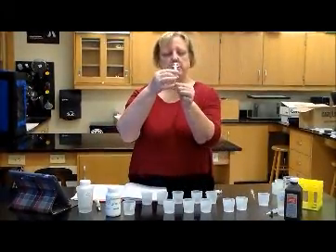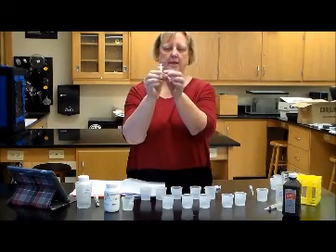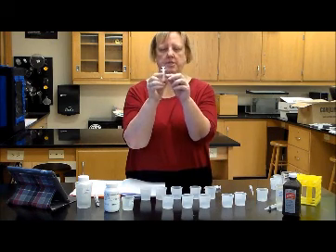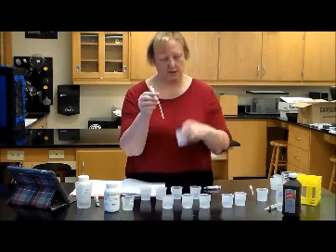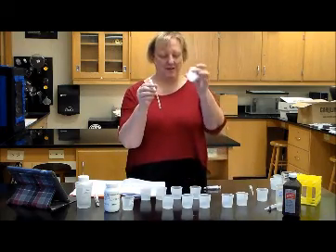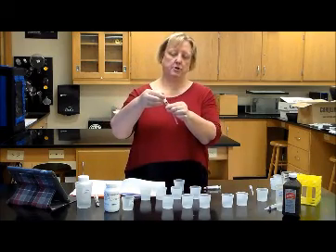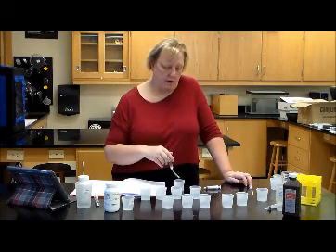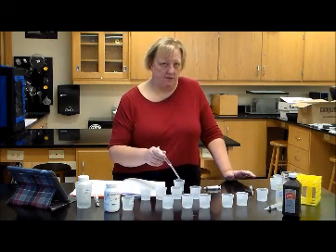and you're going to fill up this special syringe with the potassium permanganate. Make sure that you read very carefully how much you put into this tube. Then, again, do this with your titration cup, not in your individual cups, because you'll have to start over. So make sure you put it in here. You're going to have this syringe at a certain point, mark down how much you're putting in there, and then very carefully, drop by drop. You don't want to put it in there too fast.